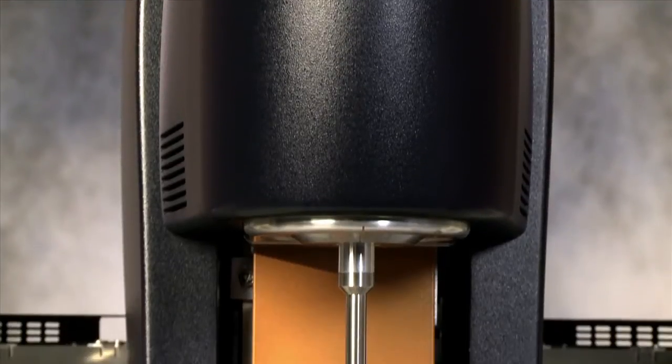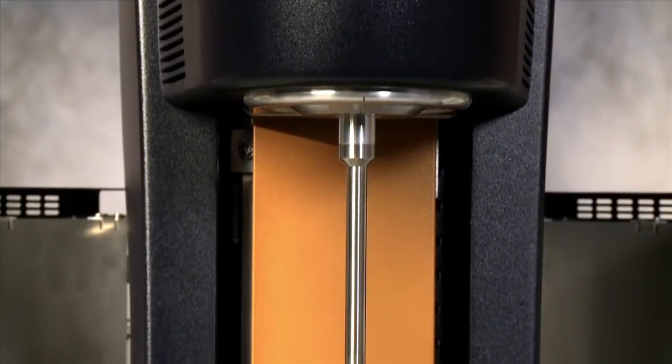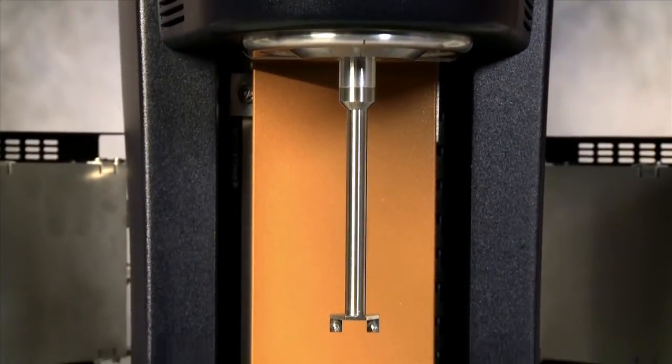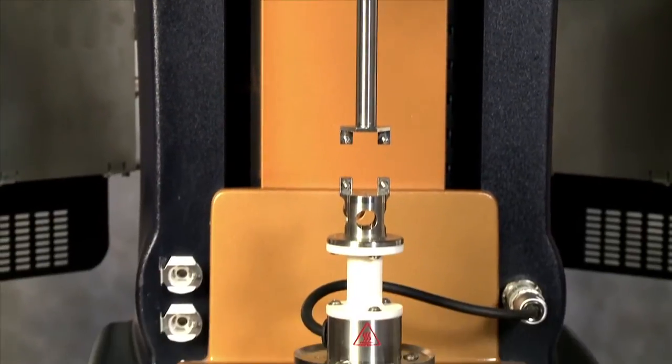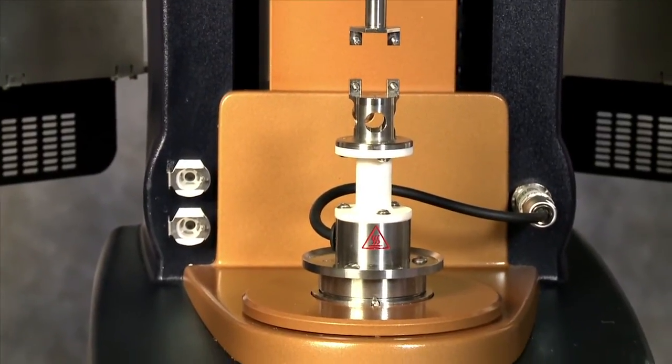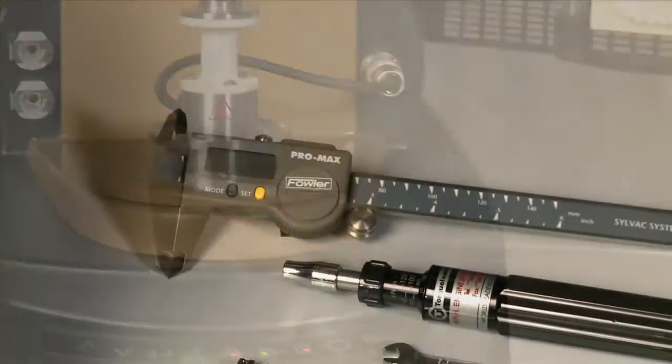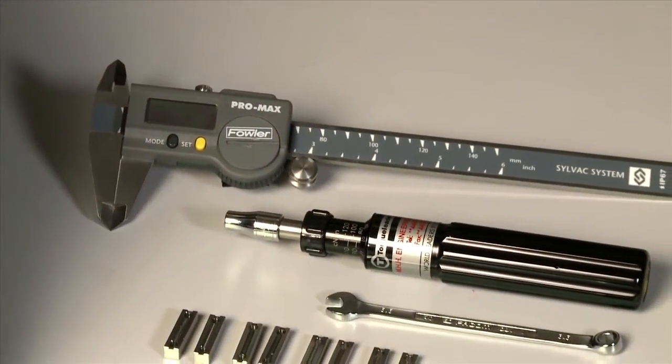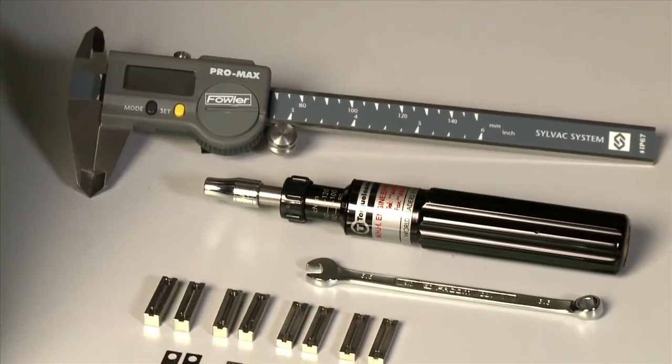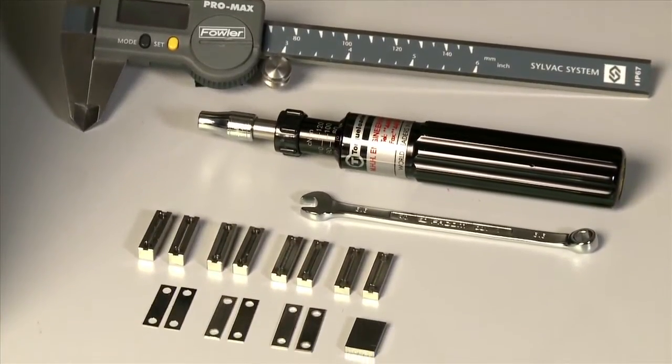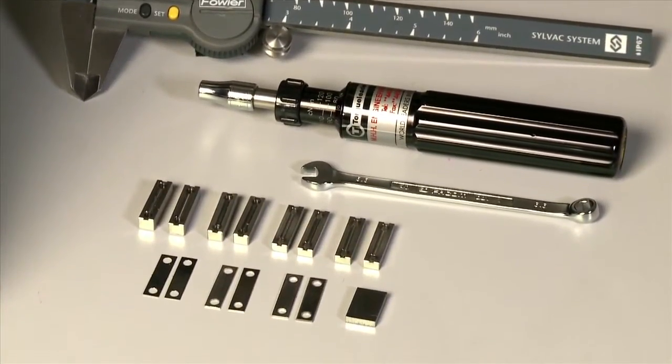The rectangular torsion geometry kit includes an upper and lower smart swap geometry. The kit also includes the appropriate tools, clamp base, and spacers required for the measurement.